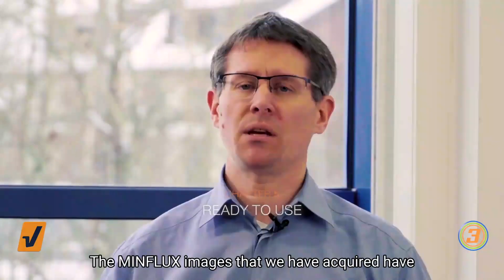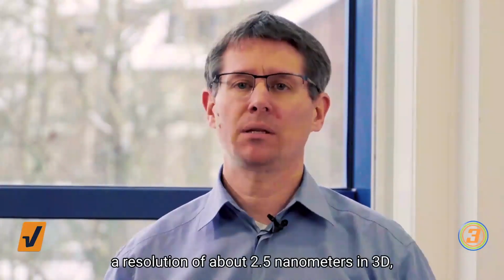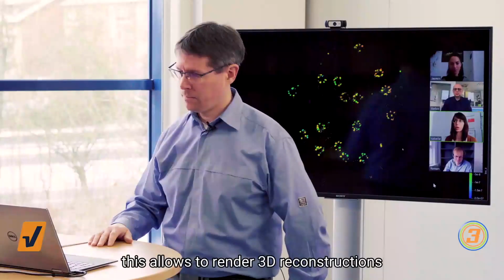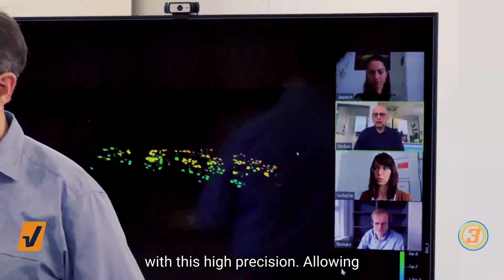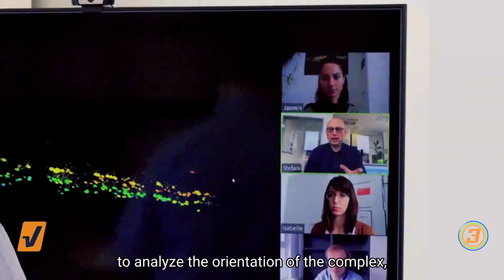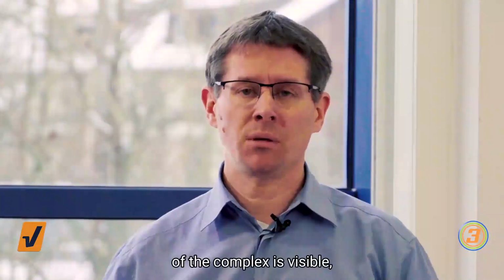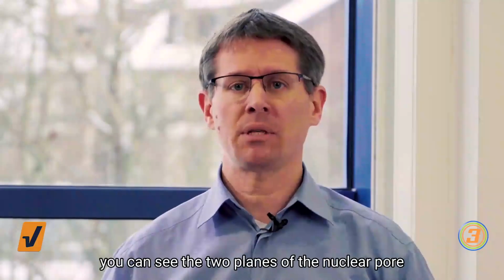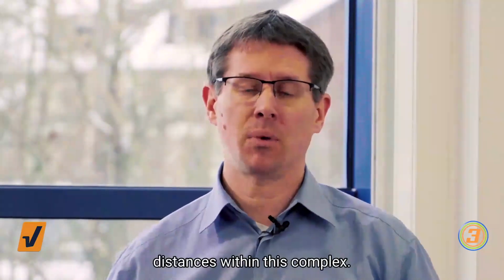The MINFLUX images that we have acquired have a resolution of about 2.5 nanometers in 3D. This allows to render 3D reconstructions with this high precision, allowing to analyze the orientation of the complex. For instance, the octagonal symmetry of the complex is visible. You can see the two planes of the nuclear pore complex and then measure distances within this complex.